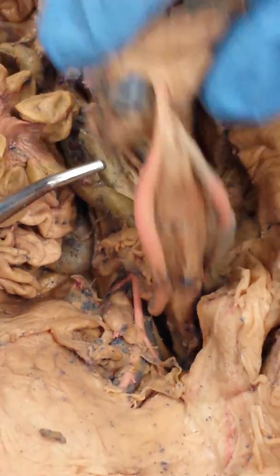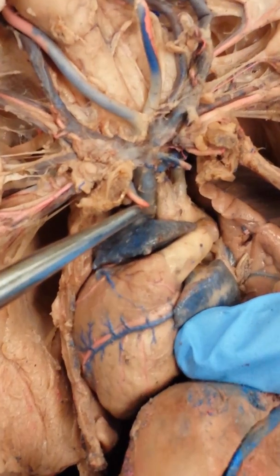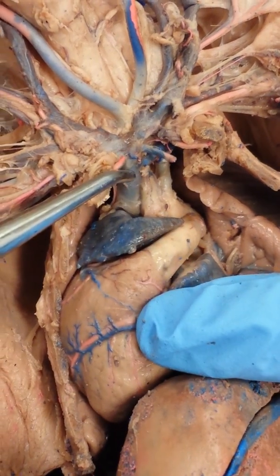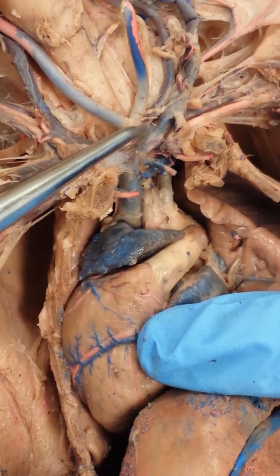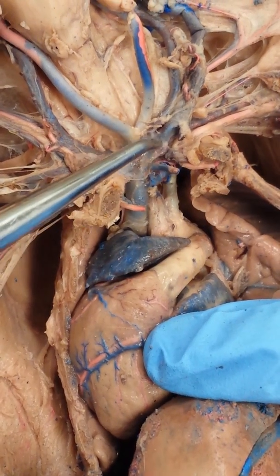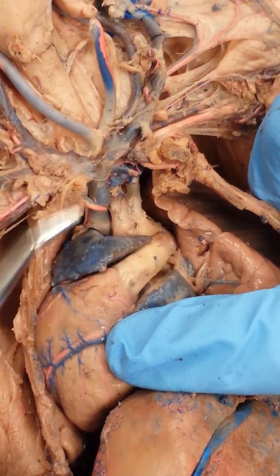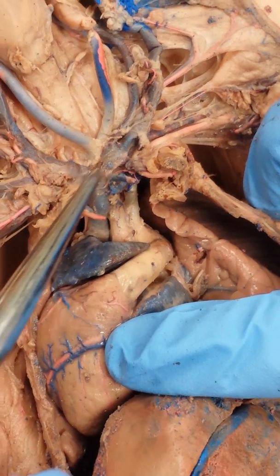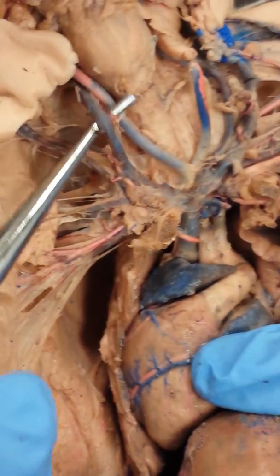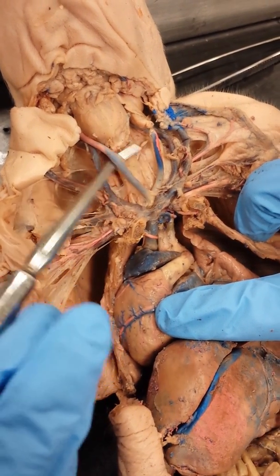So let's go over the veins. We're going to go to the top of the heart. I'm going to move up here. So first we have an anterior vena cava right here. Alright, that will eventually drain into the right atrium. We're going to form the letter V next, called the brachiocephalic veins. So it's really important that you understand there's two brachiocephalic veins, but only one brachiocephalic artery. Okay? Now, branching off of the brachiocephalic veins is the internal jugular. Alright, it's really important you know that's parallel to the common carotid artery.